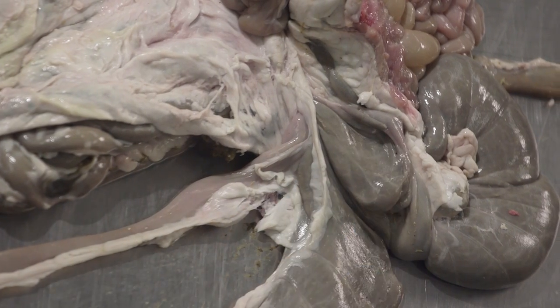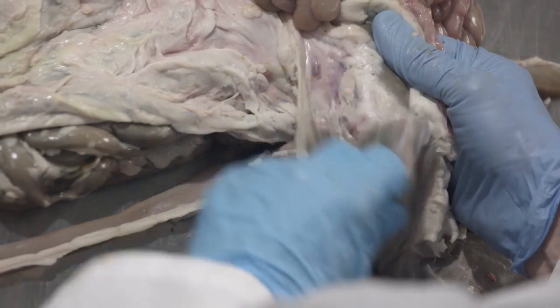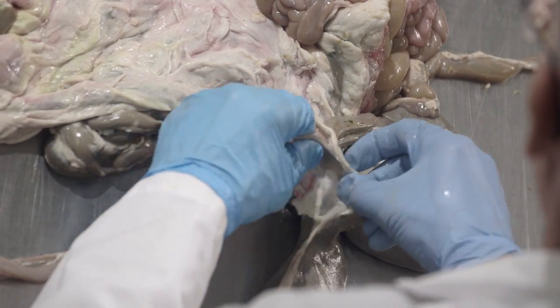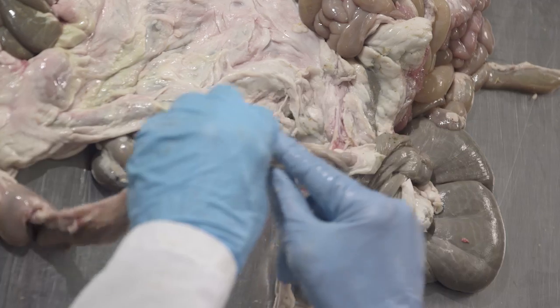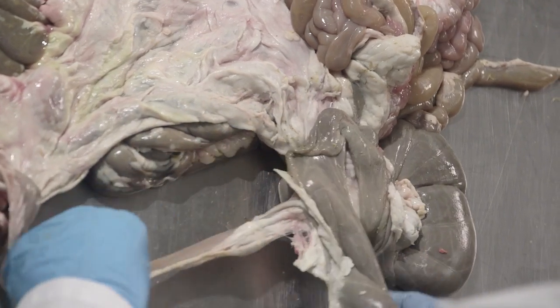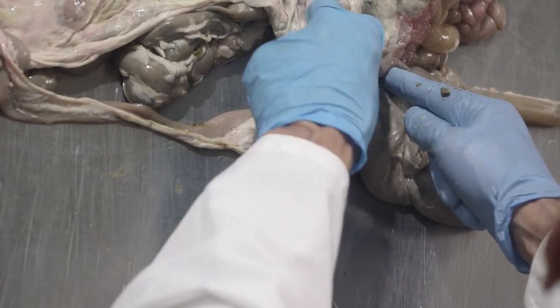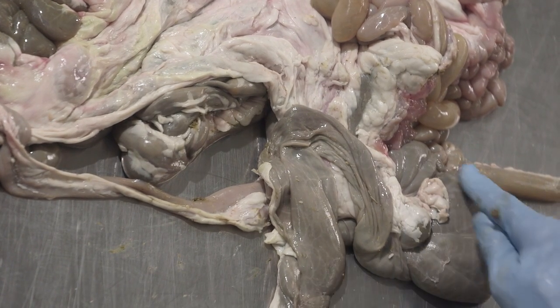So food material comes in, goes either into the cecum, or it can go in this direction, which you can't really see that clearly. I'm trying to dissect things away a little bit more. But there's that junction. So, the ileum comes in, and like so. Let's lay that out. Okay, so ileum comes in right there, and it can either go down this way or it can go up like this and into the colon. Okay, the first part of the colon, what we call the proximal colon, that area.